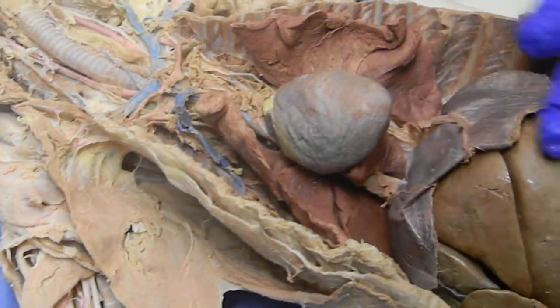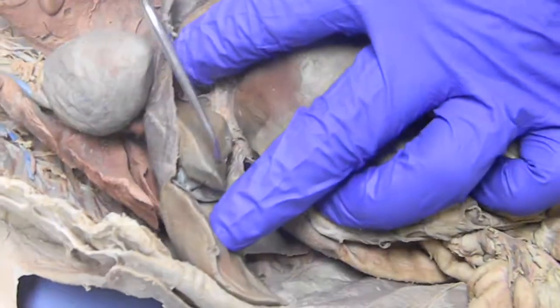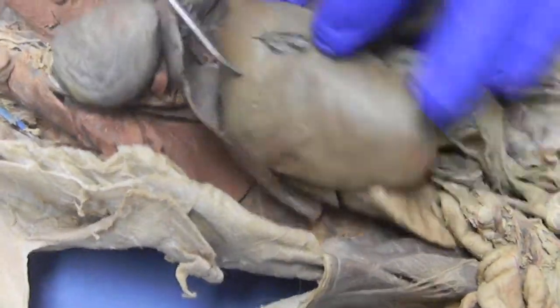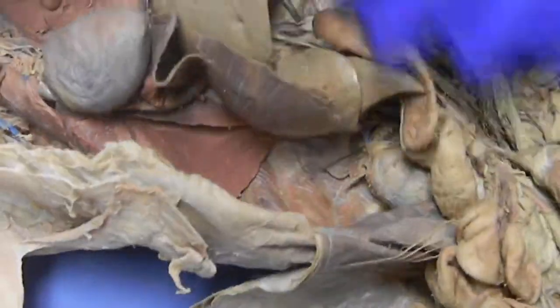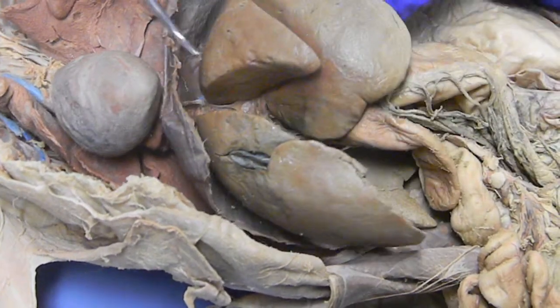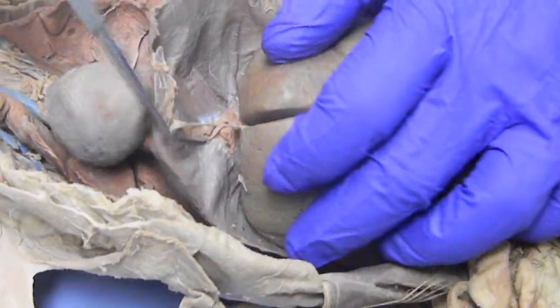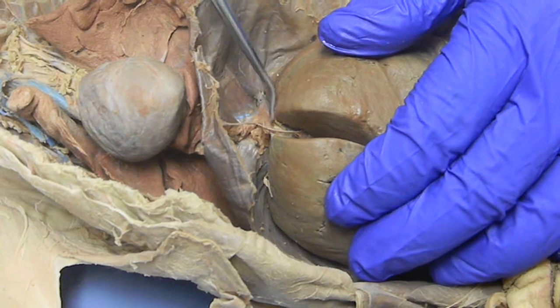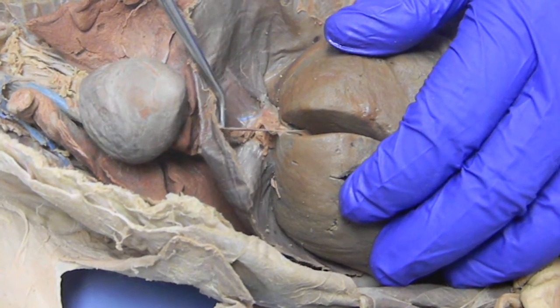The diaphragm. The liver. We have the quadrate lobe, which is the gallbladder dividing the right medial lobe. We have the right lateral lobe and the caudate lobe, which is here as well as here. We have the left medial lobe and the left lateral lobe. The piece of transverse tissue that goes in between the diaphragm and the two right and left sides of the liver right here, it's broken, is the falciform ligament. The thickening on its edge is the round ligament.